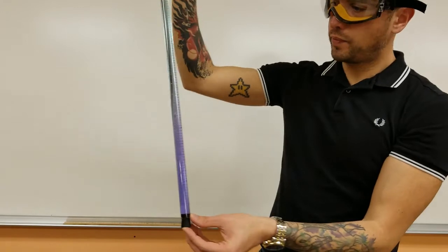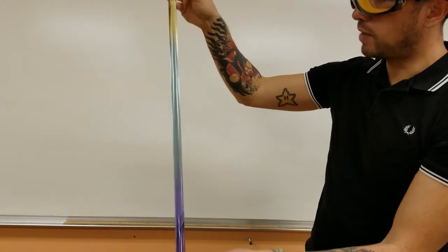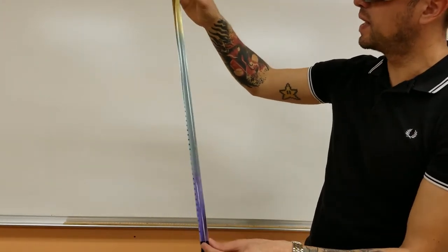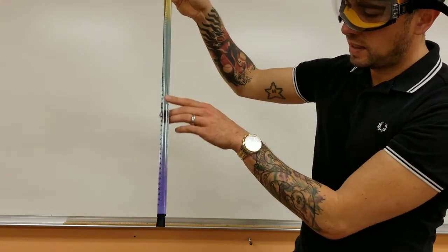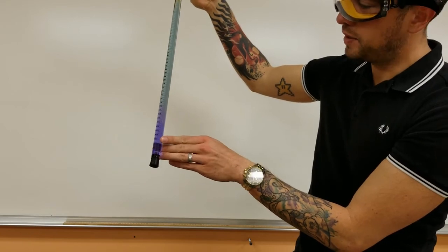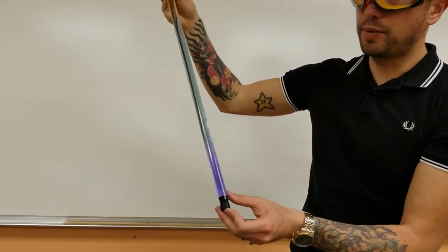you can see you get pretty much a full range where you have the acidic solution still up here going toward neutral and then turning basic purplish down here. We'll give it another mix.